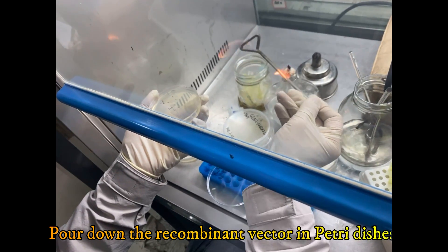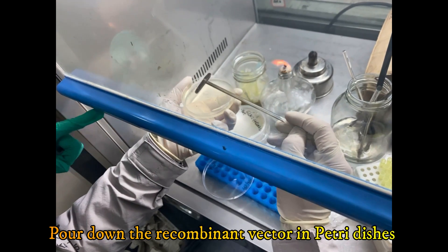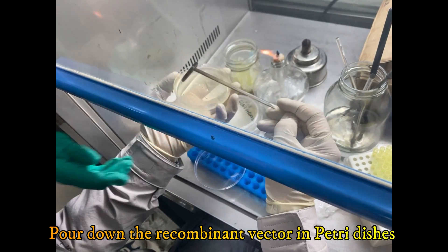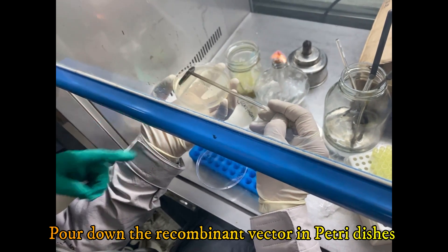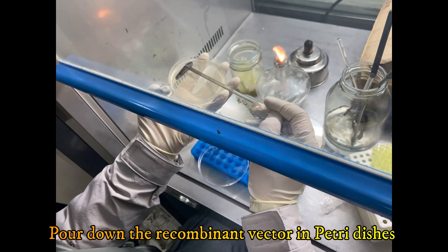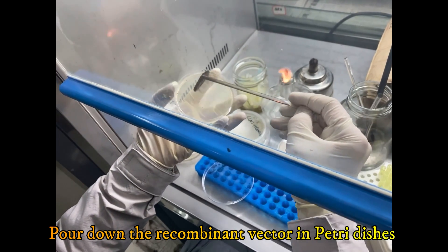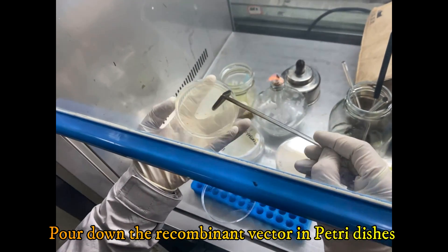We should sterilize the spreader before spreading in order to avoid contamination, and we should use slow speed in order to avoid damage to the LB media. After that we can seal the petri dishes tightly with tape.